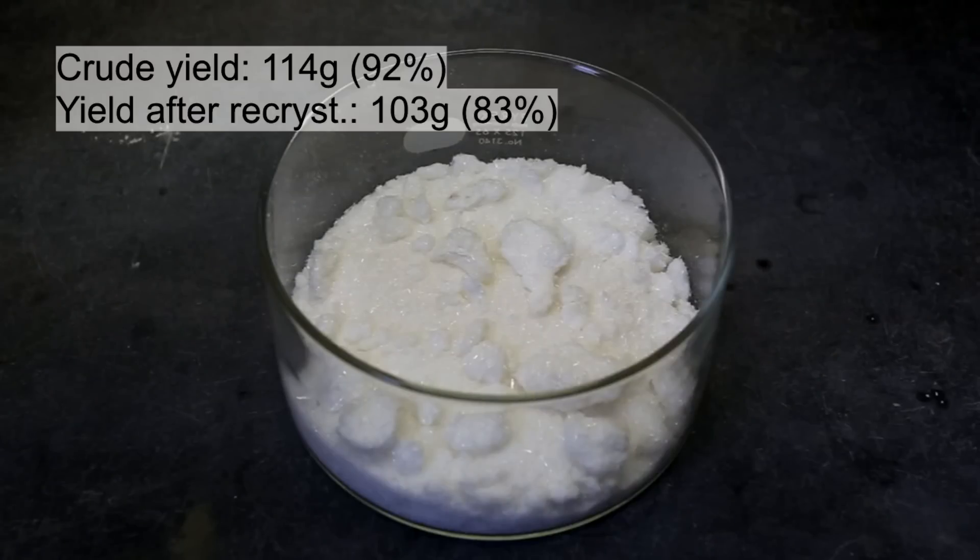In the end, after the recrystallization, my yield of the hydrolysis was about 83%. There was a massive almost 9% loss due to the recrystallization. For this reason, I am emphasizing again to wash your product thoroughly and avoid the recrystallization. In the end, my total overall yield of the extraction and the hydrolysis was about 80%.